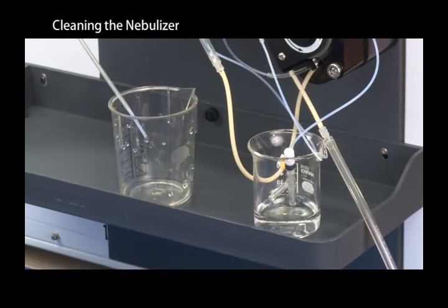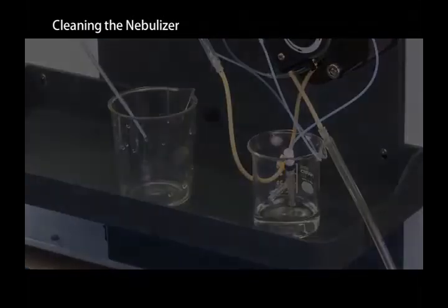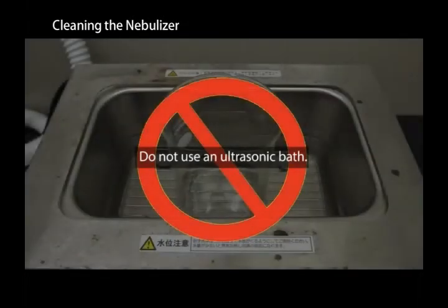Take care not to damage the microstructure of the nebulizer tip. Using ultrasonic cleaning can damage nebulizers. Do not clean nebulizers in an ultrasonic bath.